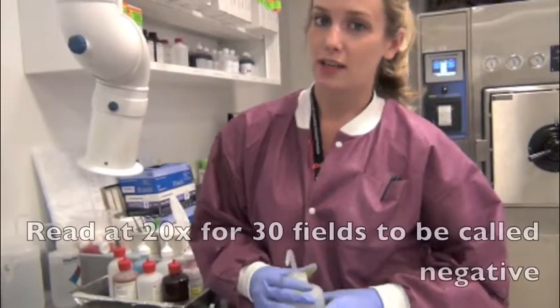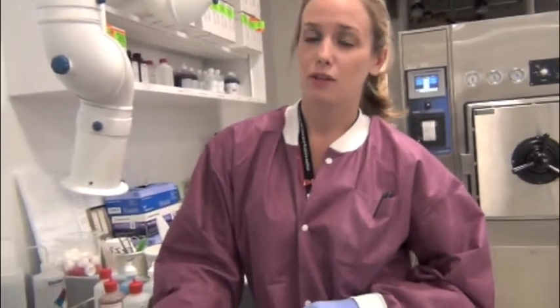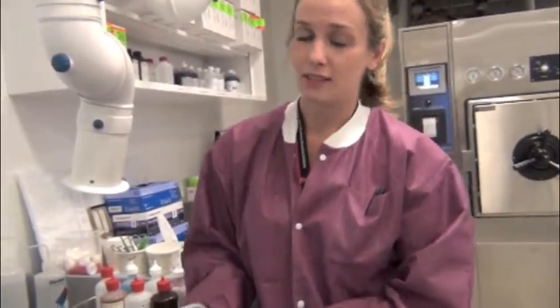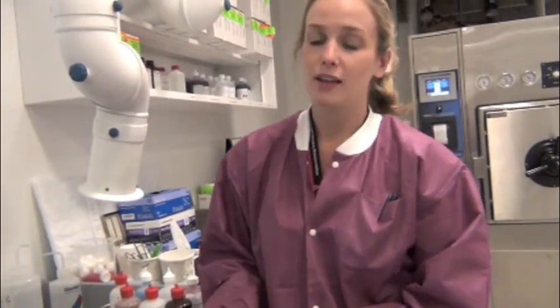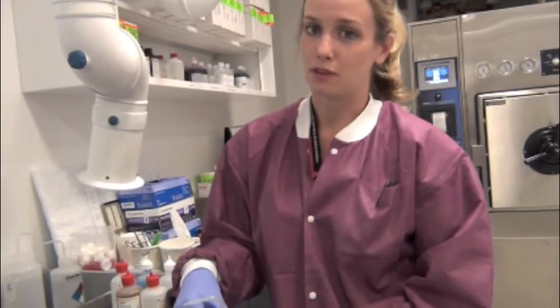When we're reading fluorescent slides, we read them at 20x, and you have to read at least 30 fields in order for it to be called negative. Compared to the Ziehl-Neelsen stains, you have to read 300 fields at 100x. So you have to stay there for a lot longer, meaning that your auramine stain is much more sensitive. So that's why we use it for direct specimens, so we can decrease the amount of time it takes to read them. The only downside to the auramine stain is that it might be difficult to pick up rapid growers. They might not pick up the stain as well as they would with the Ziehl-Neelsen.